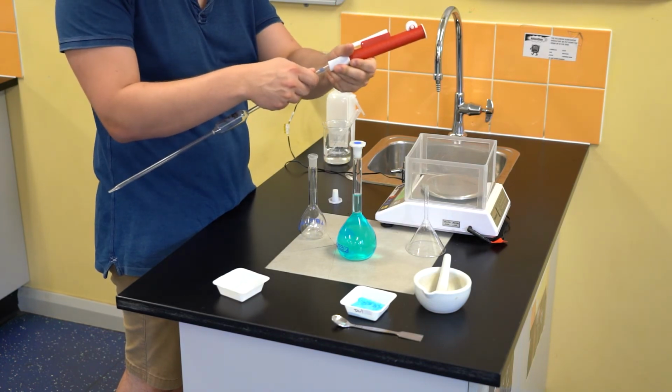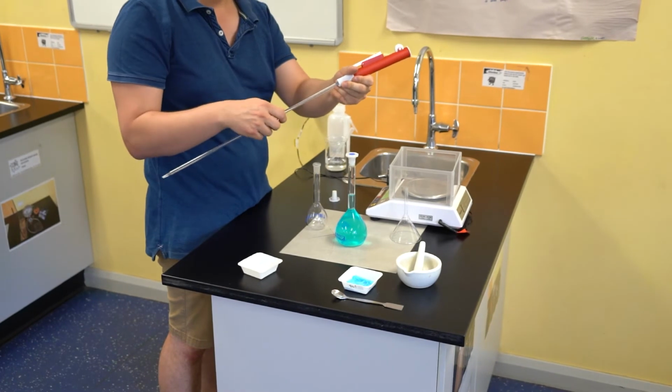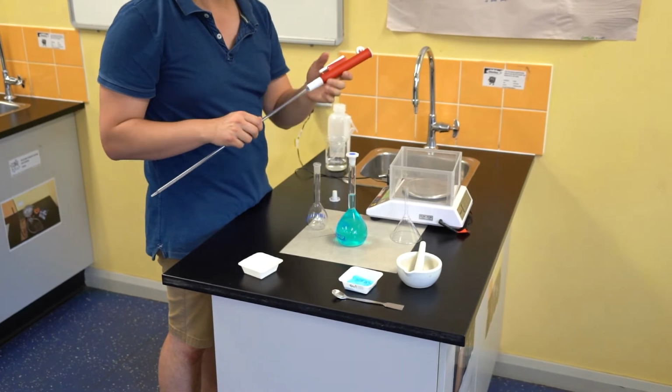Notice that my hands are really close to each other and are on the joining end of the filler and the pipette itself. My hands are in this position for safety reasons. Potentially you can snap the very thin parts of the pipette itself if the wrong angle and amount of pressure is applied to it. So by placing your hands really closely, you reduce the risk of the pipette snapping. It's a little bit difficult to see, but on the pipette filler, there is a dial that you can rotate and it pulls up liquid into the pipette just like a straw.